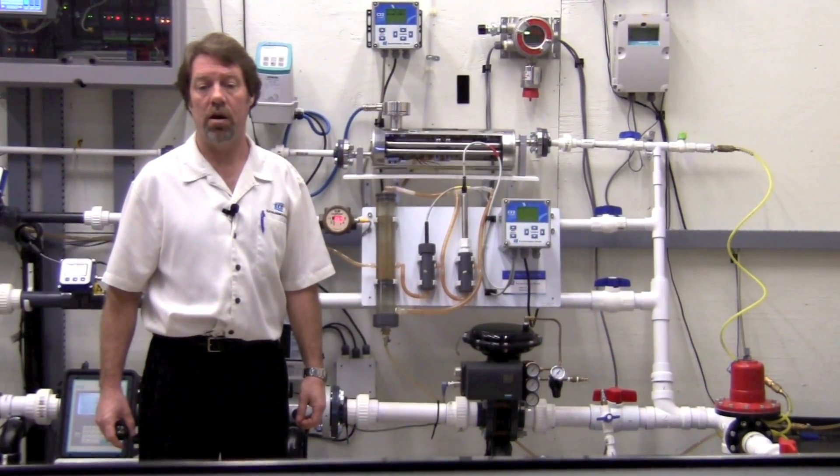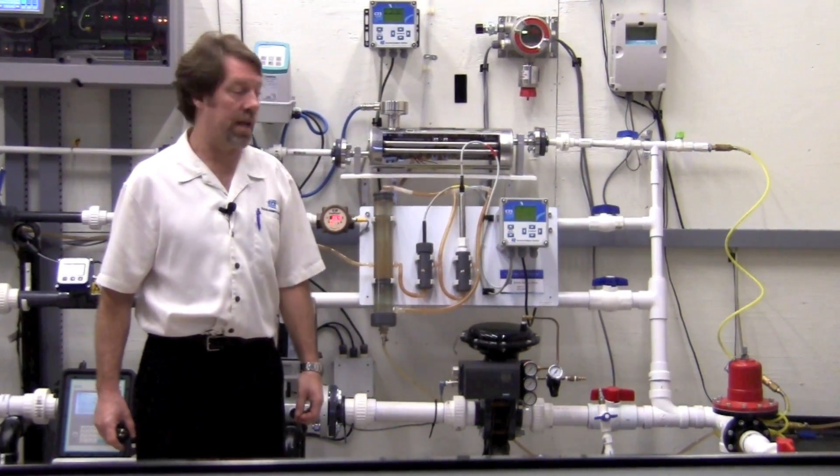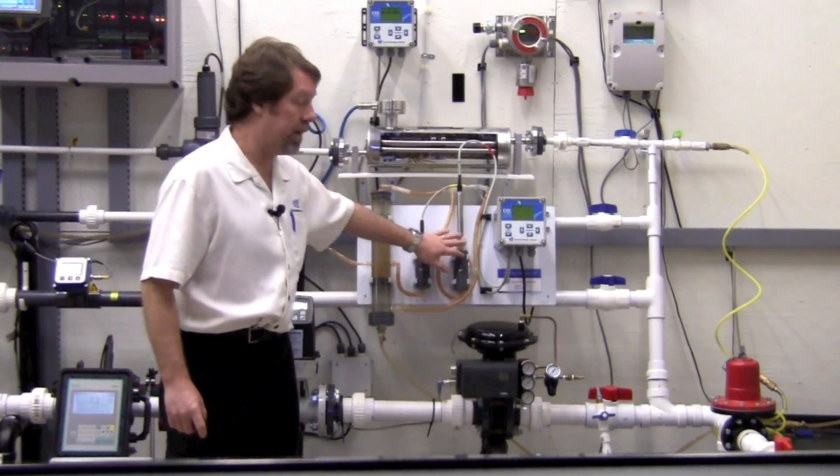After the initial start-up, it is recommended that a sample be taken to check the calibration of both the chlorine and the pH sensors.